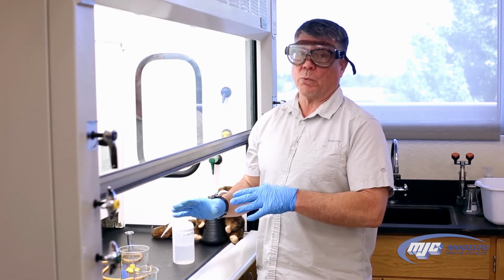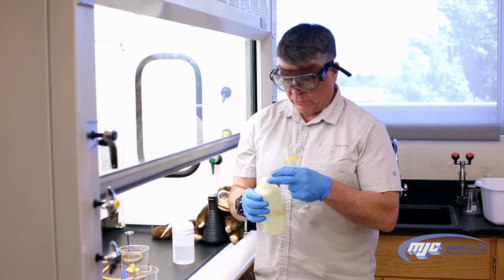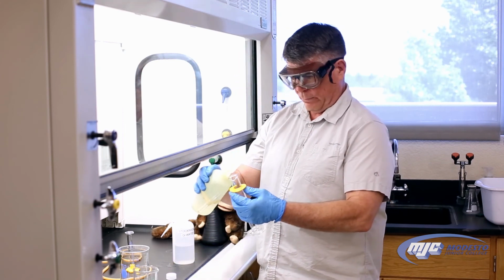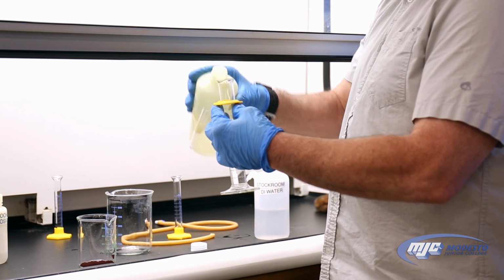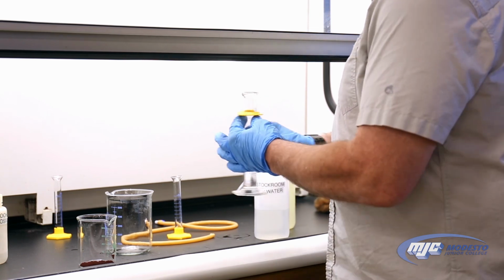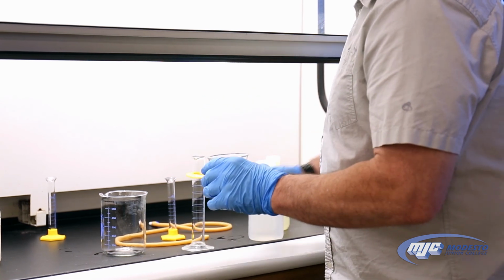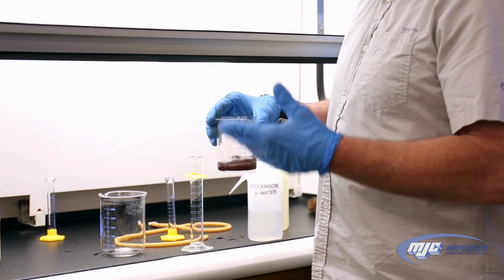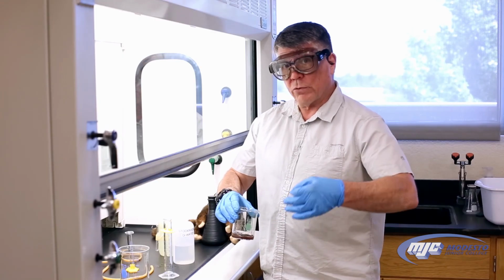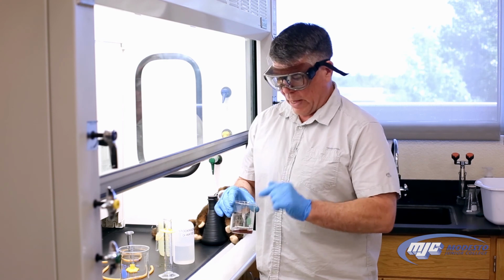We have to put that into a special waste container, organic waste. So I'm going to take some acetone, nail polish remover basically, add about 20 mL. The exact volume's not really important, close enough. What this does, guys, is when we rinse it with the acetone, this pulls all the water out, and it's still going to look wet, but it's going to be wet with acetone. Now, when we let this dry over the week in our lockers, the acetone will evaporate easily, and when we come back in a week, that will be dry.